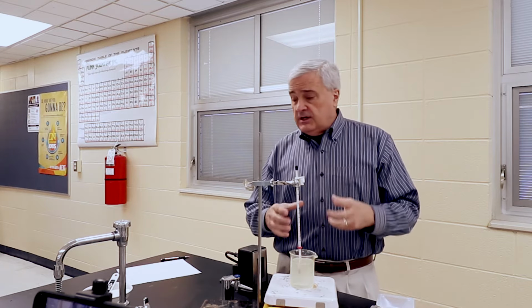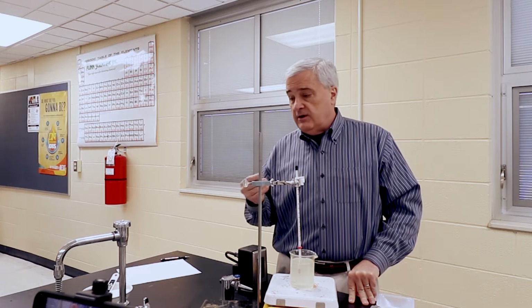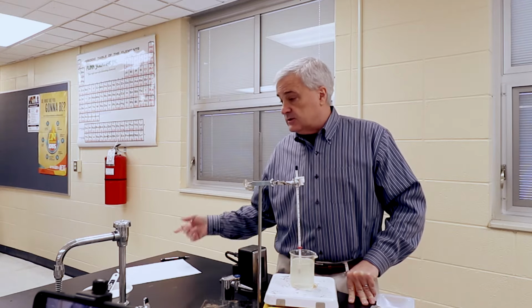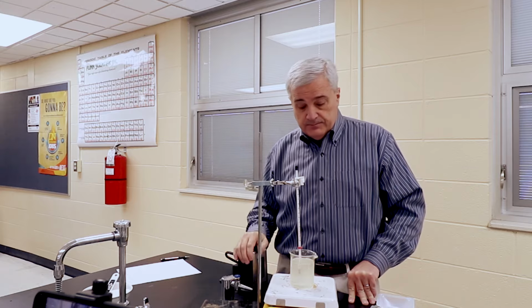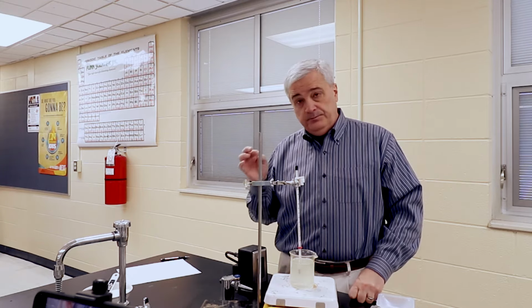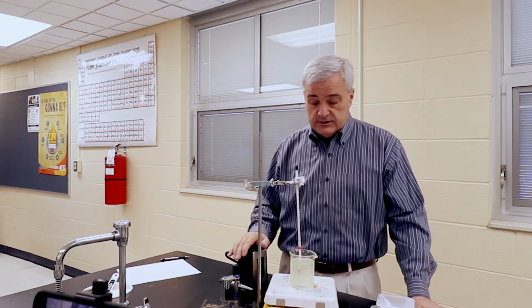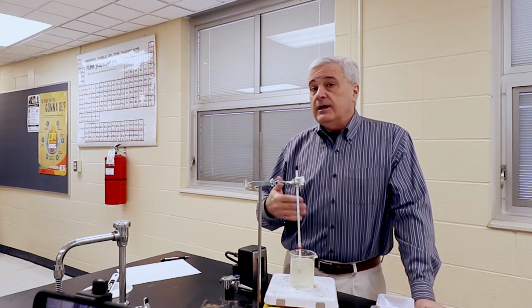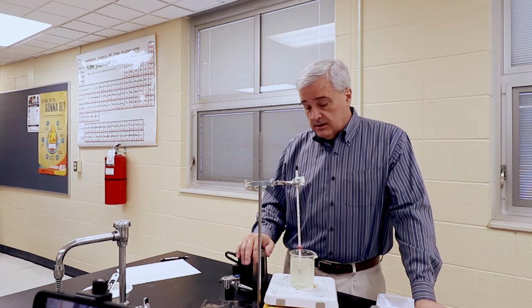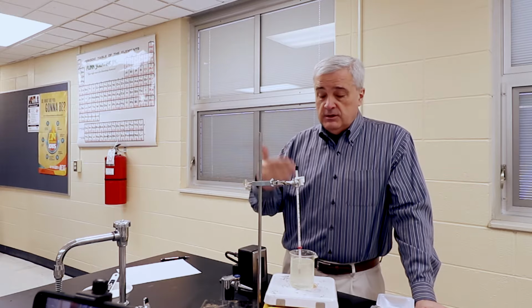The consistency of the water now is very syrupy. I had to stir with the spatula to get some of it to dissolve earlier, and it's almost like a sugary syrup. Well, it is a sugary syrup. If we were a candy maker, we'd probably be on the way to making caramel. So we're gonna let this heat up. We'll be back when the temperature gets up.